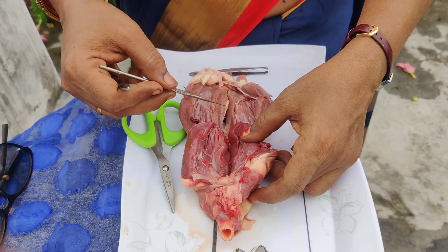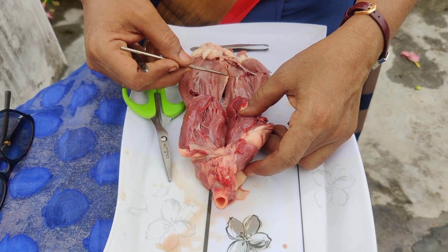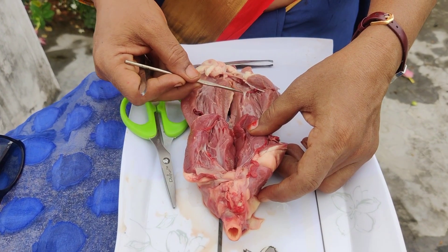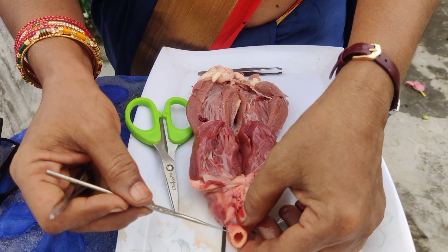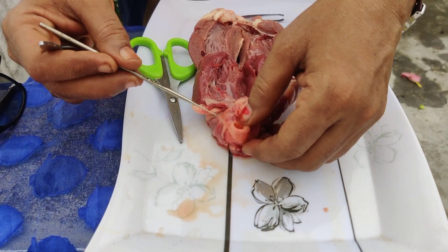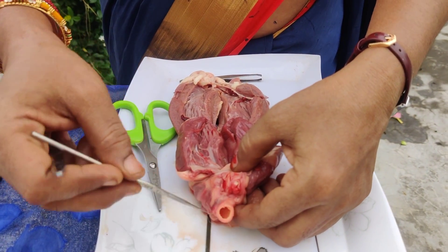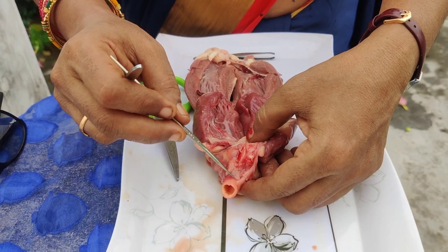Some valves are present here. The tricuspid valve is present in this area. And this is the aorta — it supplies oxygenated blood from the heart to the body parts.